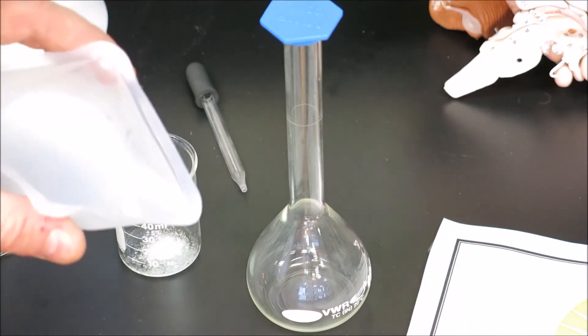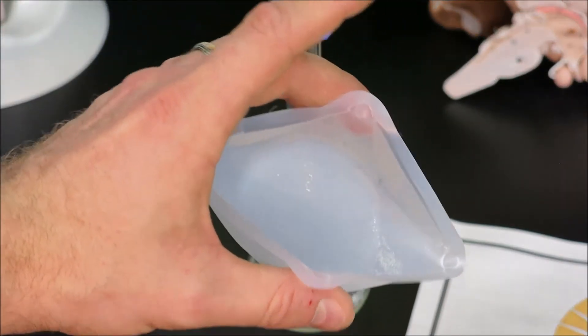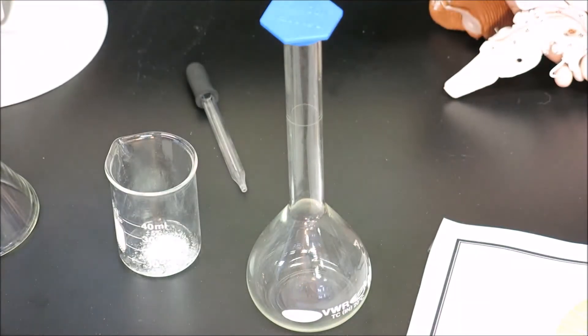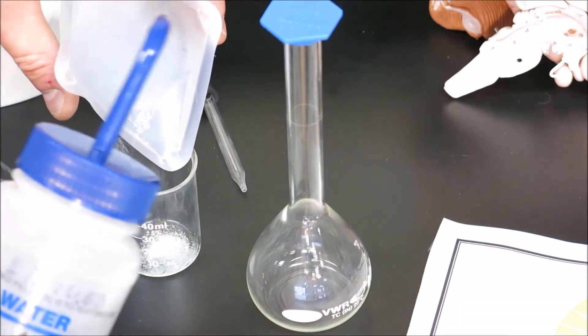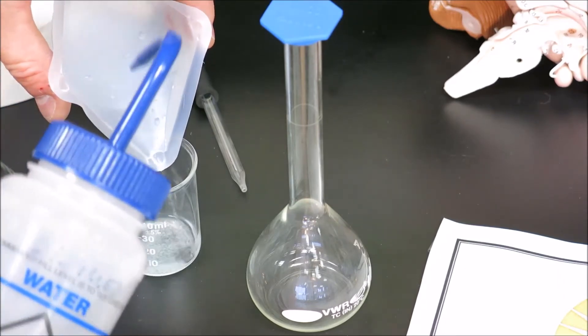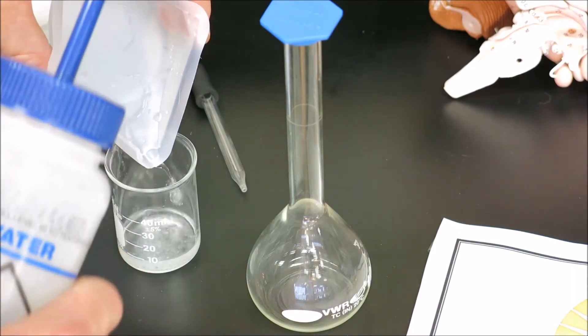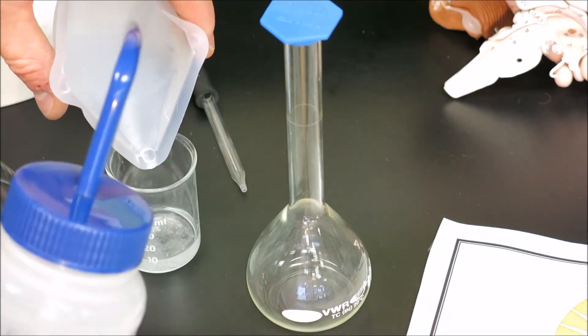As we can see, there is some solid left in the weigh boat. We need to use distilled water and rinse the weigh boat into the beaker, being careful not to splash or miss any solid.